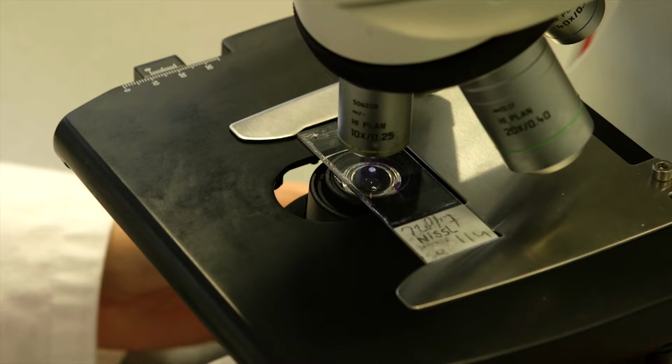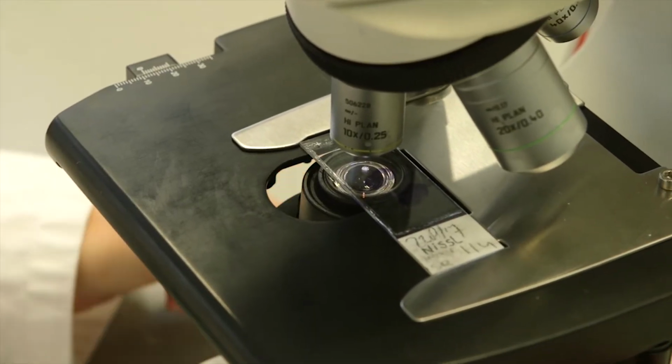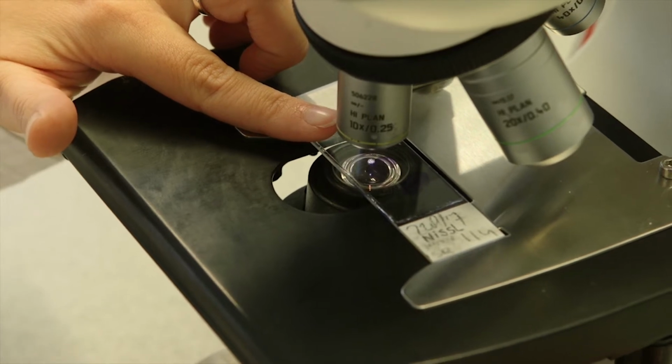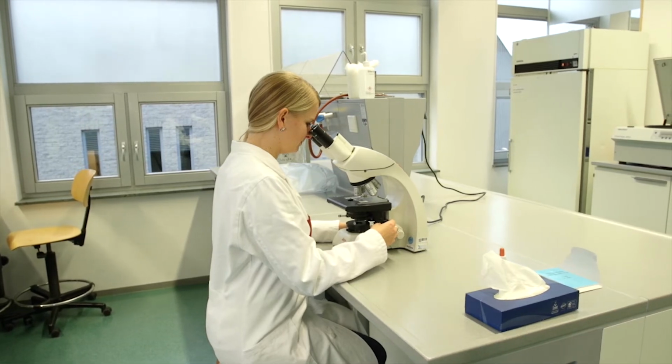The microscope should always be stored with the lowest objective clicked into position. This is often the 10 times objective. Make sure that the 10 times objective is in place because this is also the objective with which you will start setting the microscope correctly. This correct setting of the microscope is called the Köhler illumination.